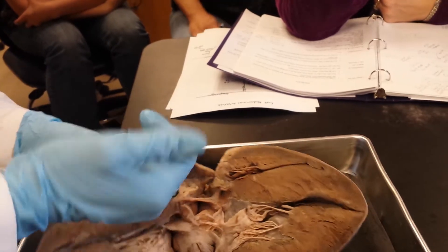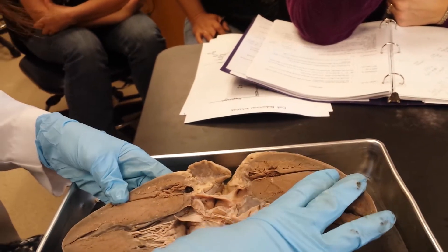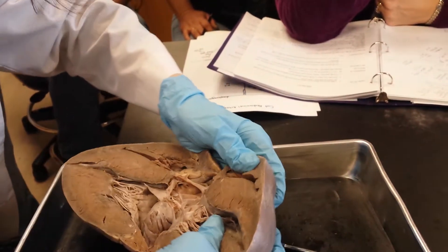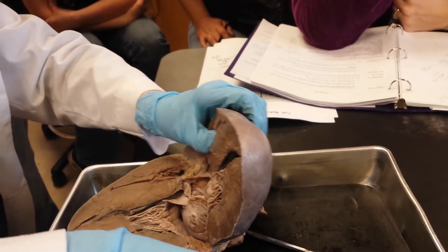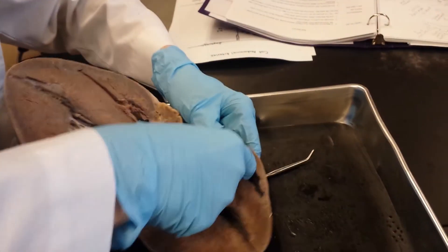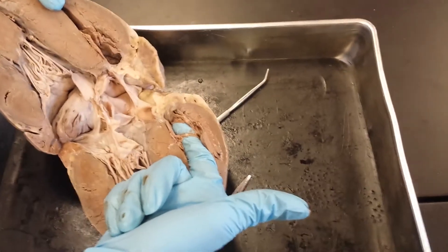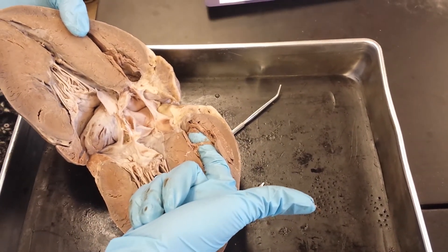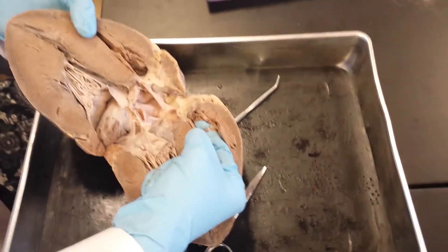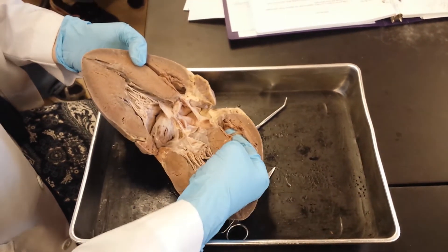You can see if I stick my finger up here I'm in the right atrium. Inside the right ventricle is what we call the moderator band — only in the right ventricle and only in the cow heart. Basically it keeps the right ventricle from overstretching. It's not a chordae tendineae — it's thicker, a little more muscular. That's your moderator band.